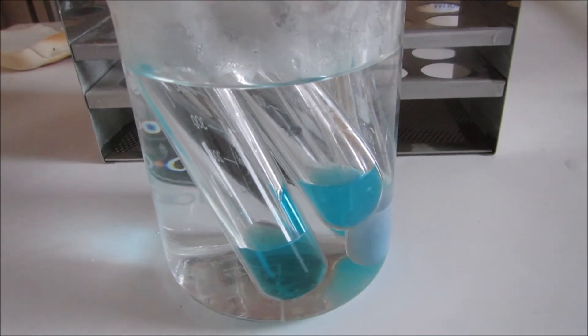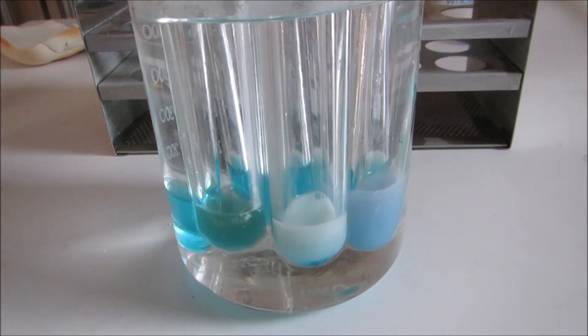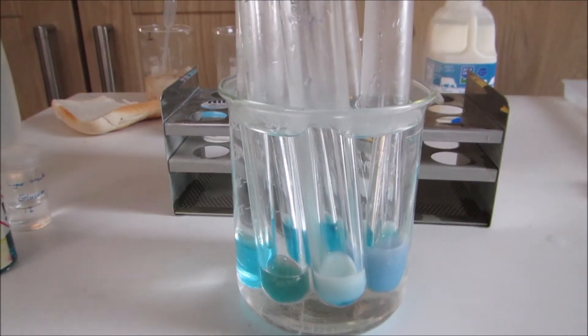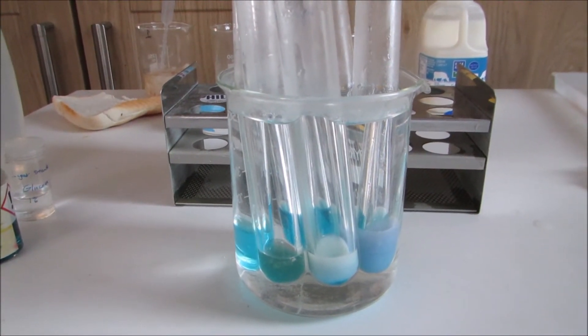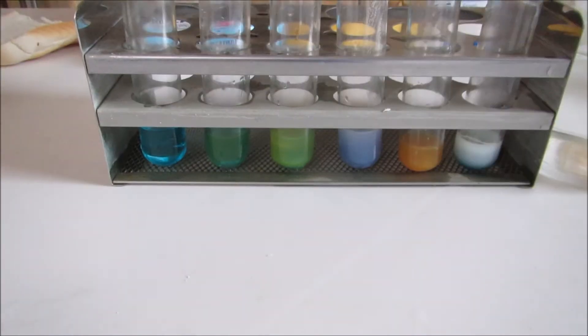Make sure you have labeled them before so you can identify which ones are which. Then you just need to leave it for around five minutes and I'll show you what they look like once they come out of the water bath.